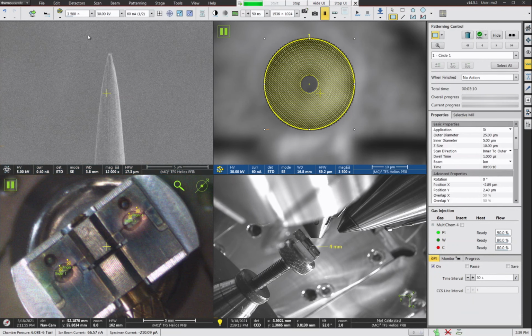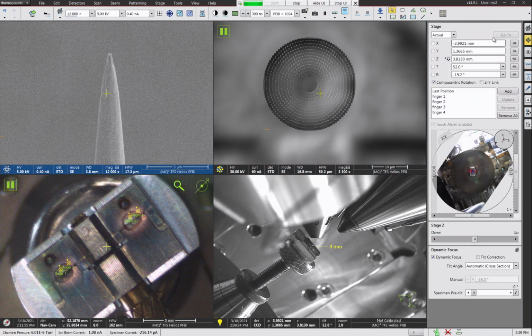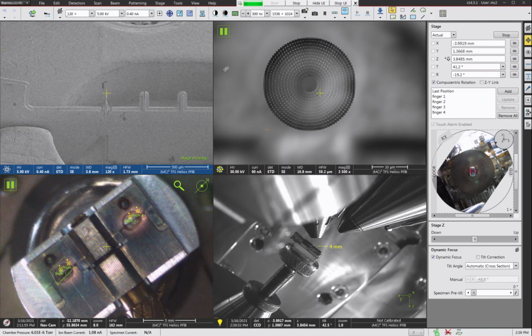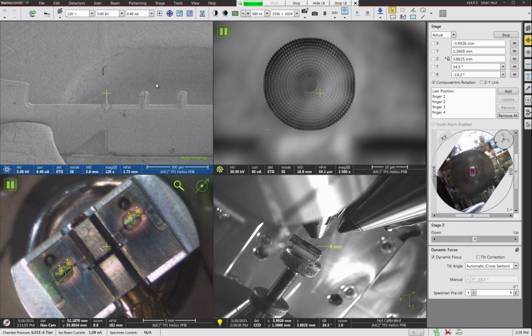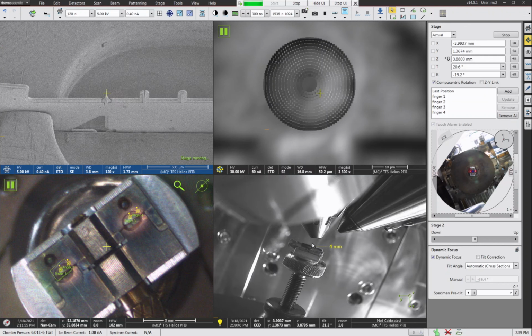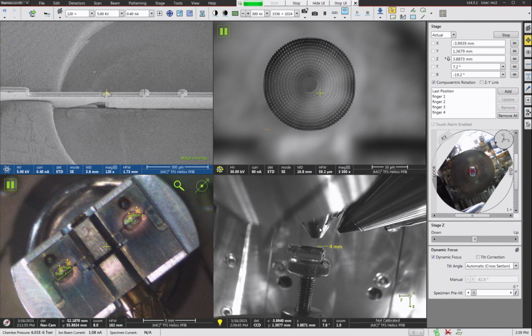So to do that, let's turn our beam current down. I'm going to go down to 1 nanoamp. And we want to make the sample as perpendicular to the FIB as we can. So on most tools, that would be going to the minus 10 degree stage tilt. So I can show you how that looks. So the FIB will still be at a 28 degree angle to the post. So you won't be able to cut it off completely flat at this angle.